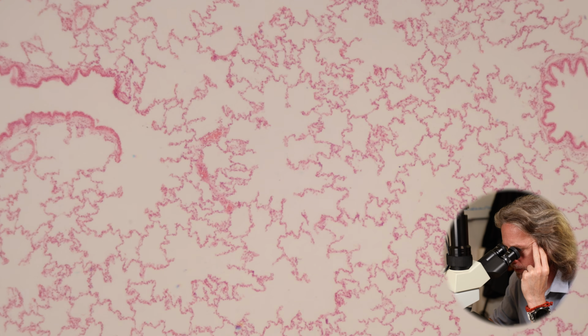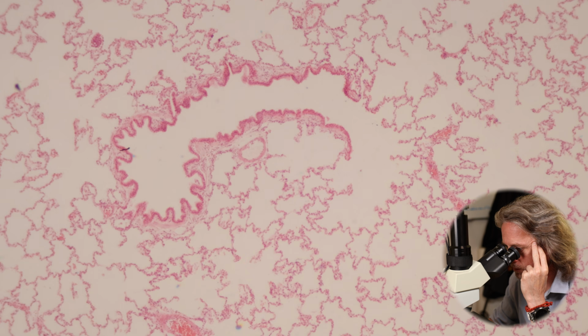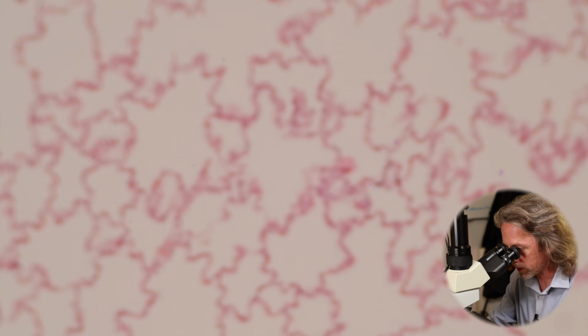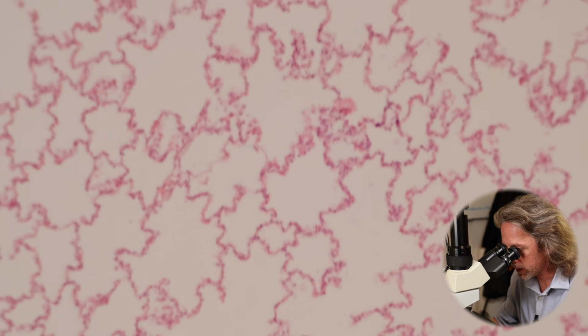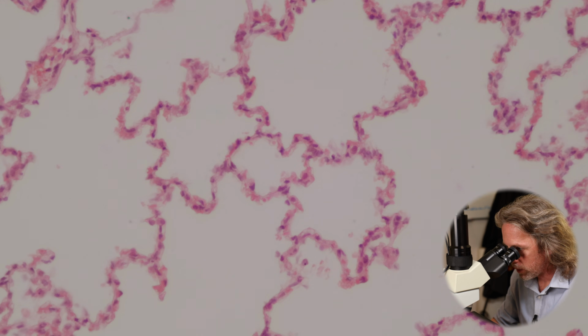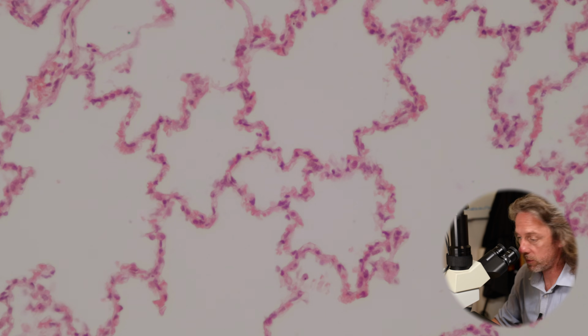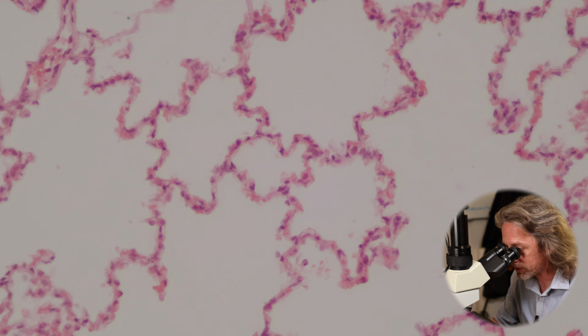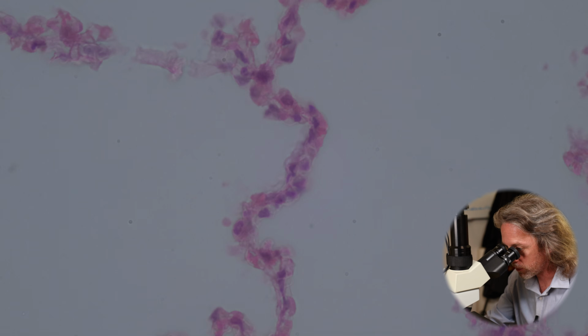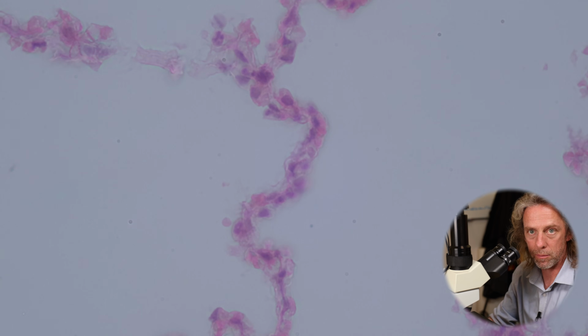Well, okay. First of all, let's just jump into any old region of the lung, any old alveoli, and see what we see. We're looking for a number of cell types. We can see very thin walls. So the alveolar cells are called pneumocytes, and we have type 1 pneumocytes and type 2 pneumocytes, and then we have a lot of capillaries in here as well. So if I go up to, this is 400 times magnification for me.